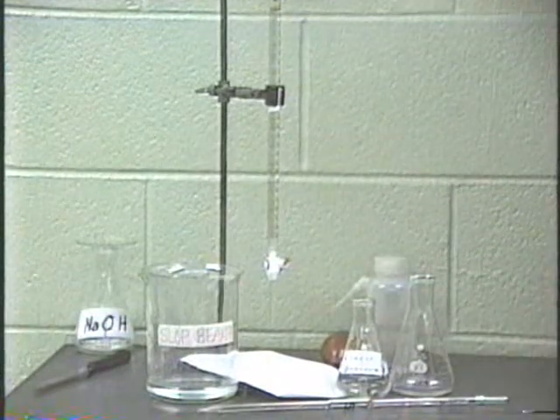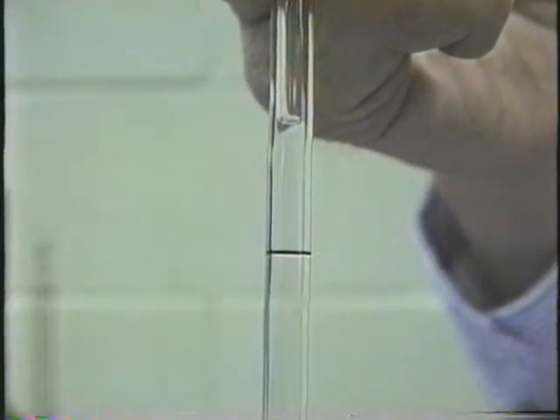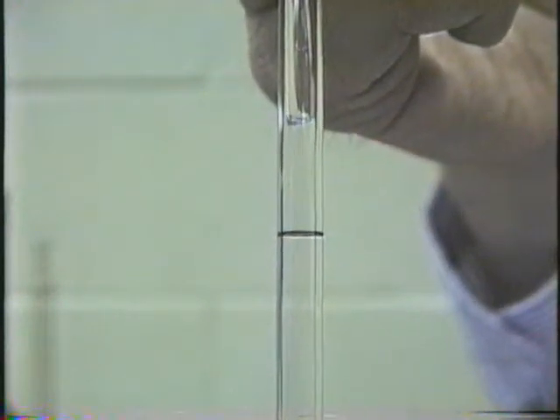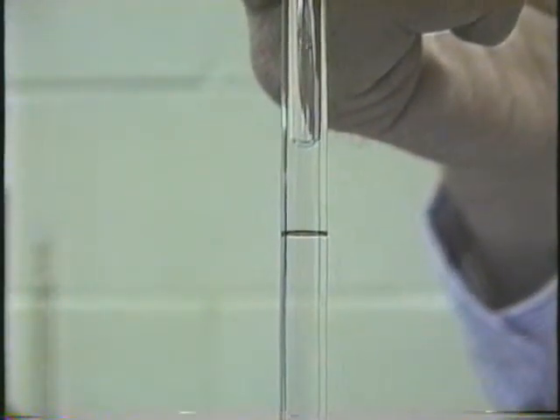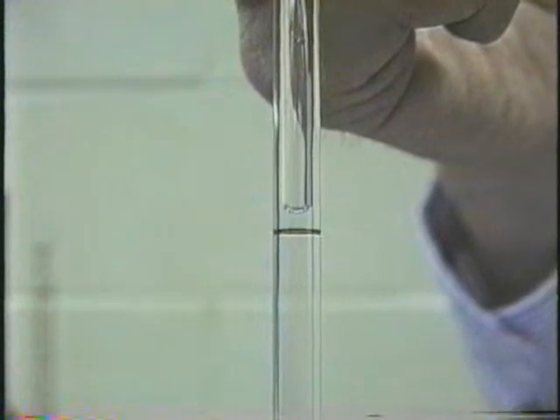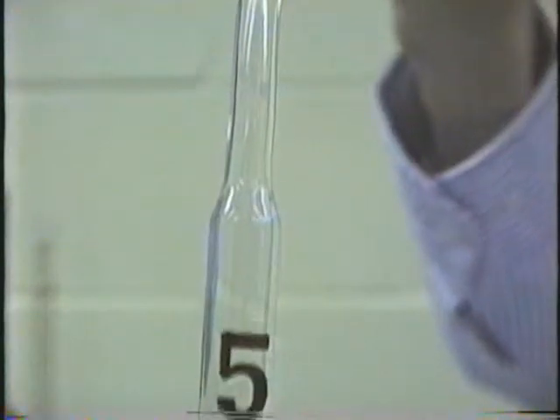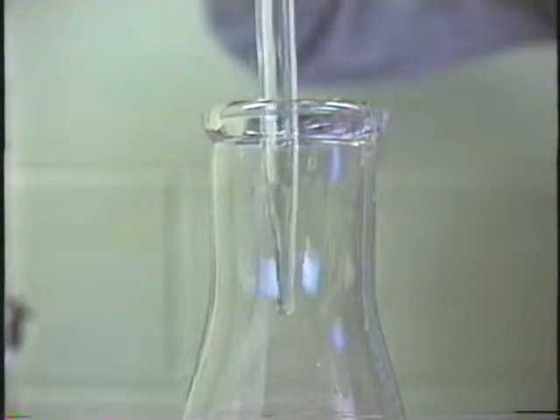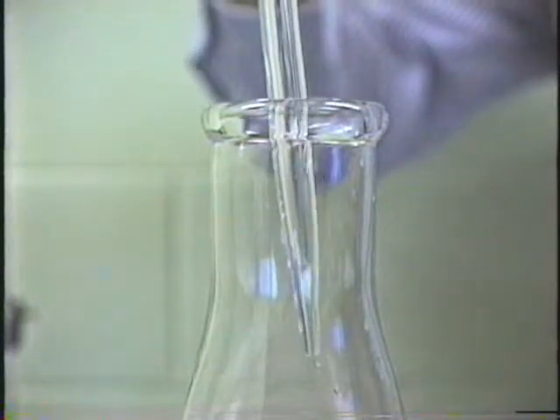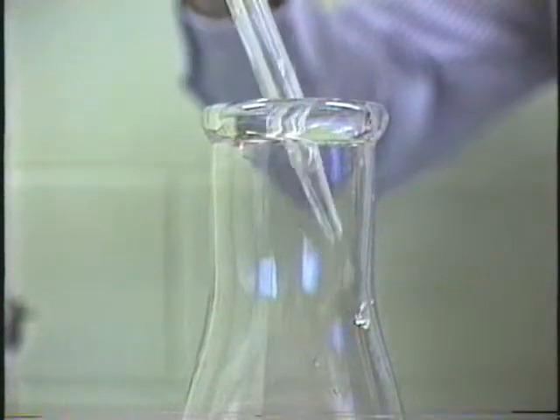Let's look at that in close-up. When the level of the liquid is above the 5 milliliter mark and your thumb is on top, you slowly release the pressure of your thumb and the liquid will start to drain out. Now you just keep it going, a little bit of patience until the bottom of the meniscus just hits the 5 milliliter mark. Then you put pressure on and now you have your 5 milliliters. Here's a close-up of the drainage of this pipette. Now you see when you're through draining, what you do is just touch the pipette to the side. Whatever comes out will come out.